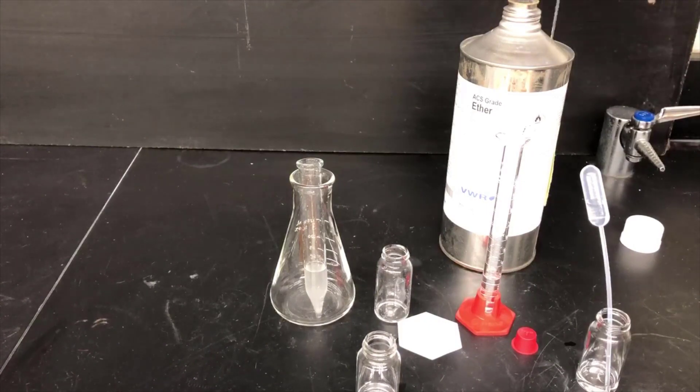I'm measuring out a fresh 4 milliliter portion of ether, and I'll put that back in with the aqueous layer.